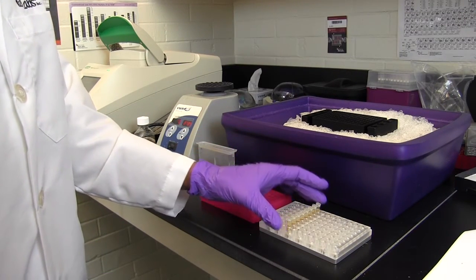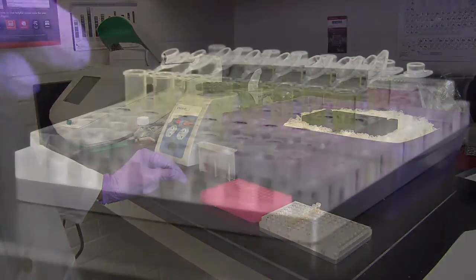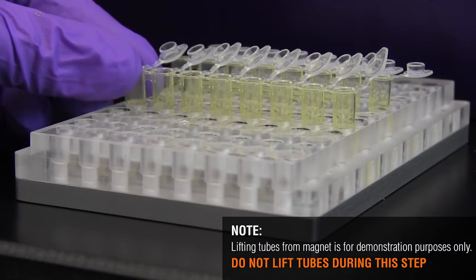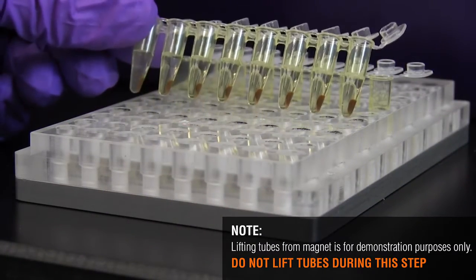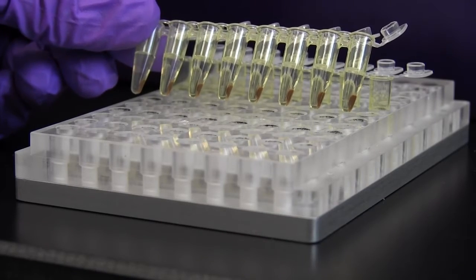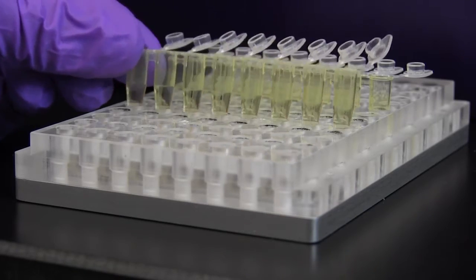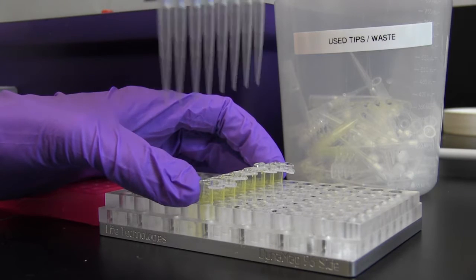After approximately 5 minutes, the beads should have separated from the supernatant. Carefully remove the supernatant and avoid disturbing the pellet.